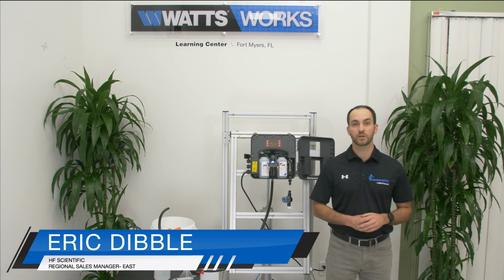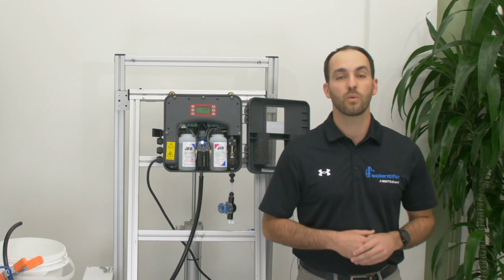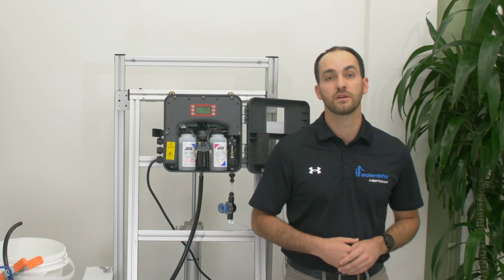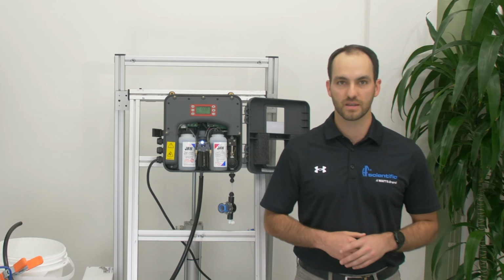This video is going to go over the CLX flow paths and some alarms associated with the flow path. Let's start by talking about water coming into the analyzer. The water coming into the analyzer through the 1/4 inch OD tube needs to be above 5 psi.